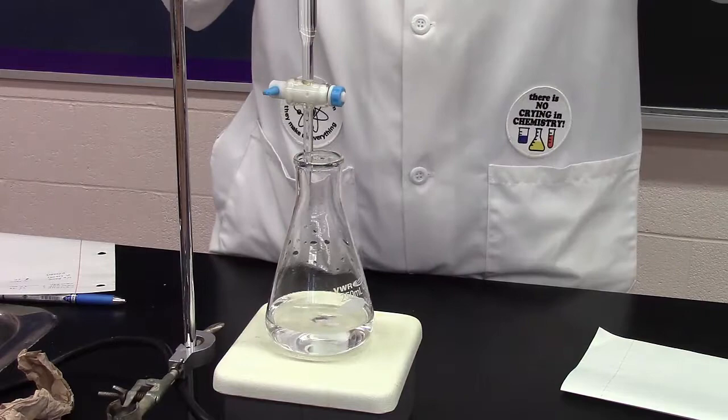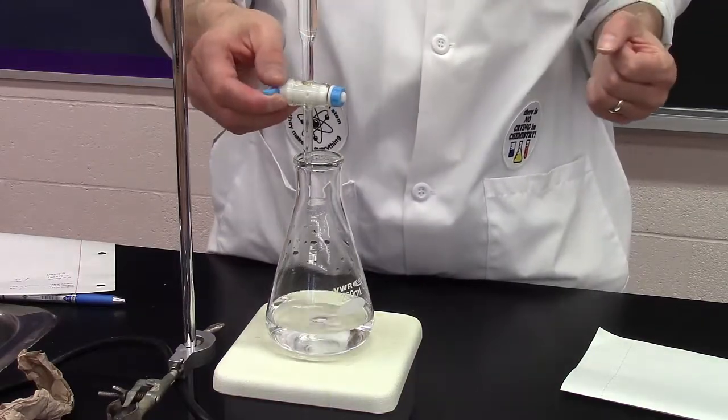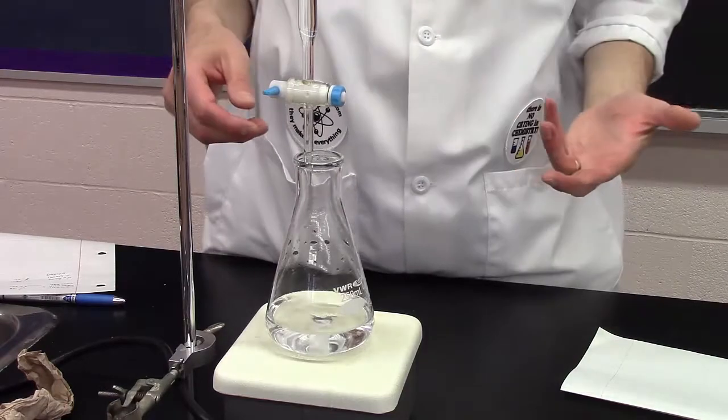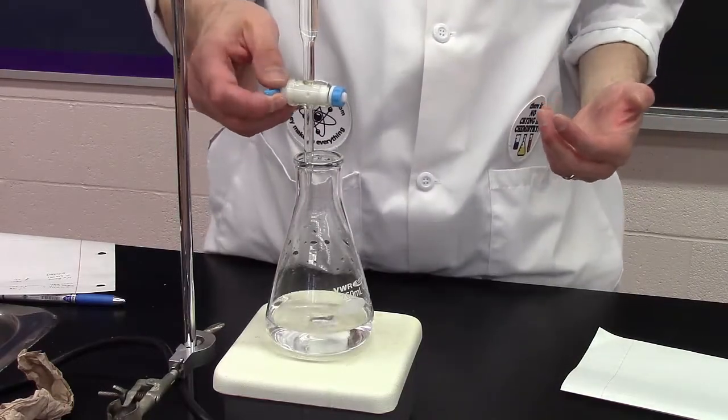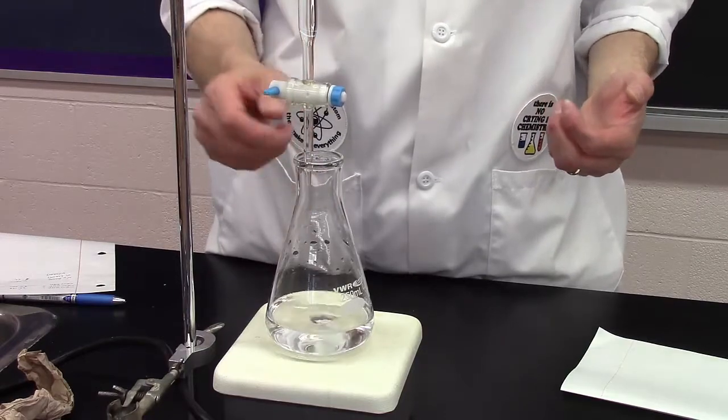I have a measurable volume of base in the burette, and I'm going to slowly add the base to the acid.